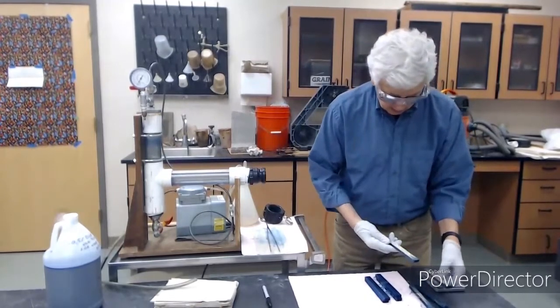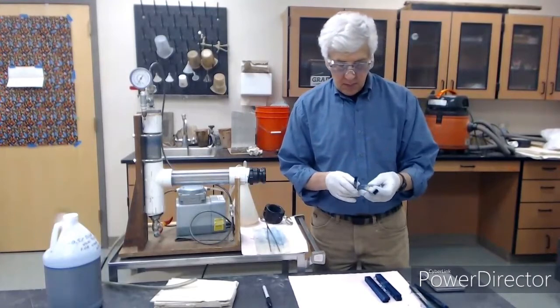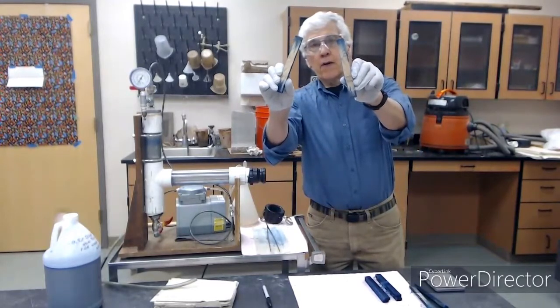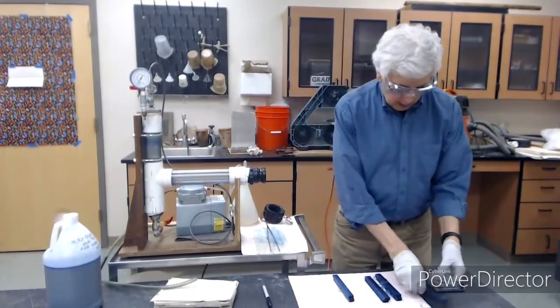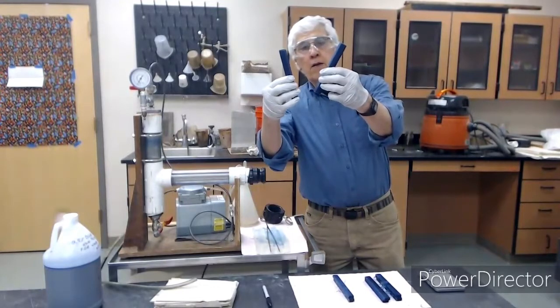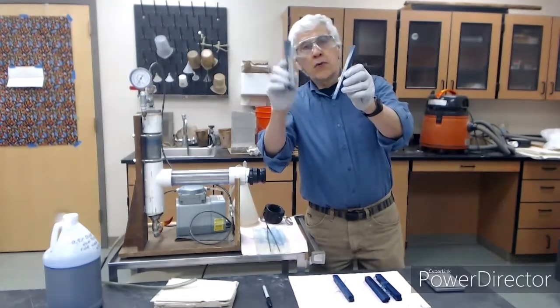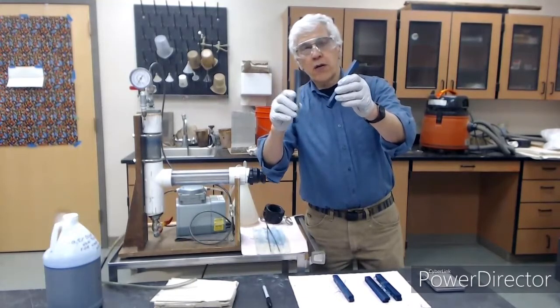This is Douglas fir number 1. Outside, inside. So now we have to figure out the penetration on the Douglas fir. And this is Douglas fir number 2, outside and inside. So notice that we did get significant penetration here, but it's all longitudinal. So you recall the longitudinal permeability is much higher than tangential or radial.